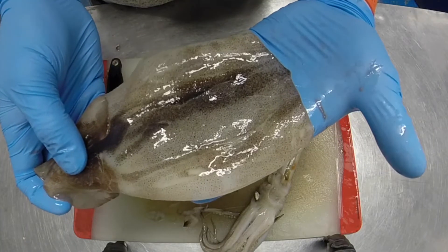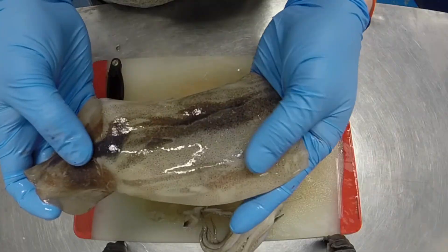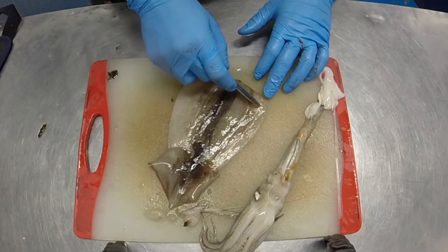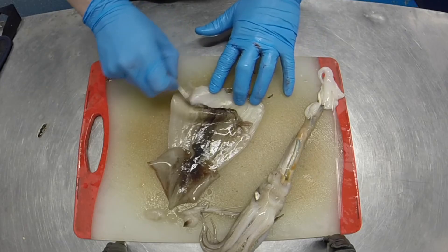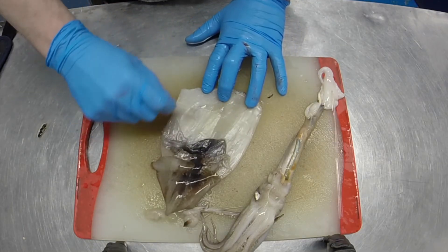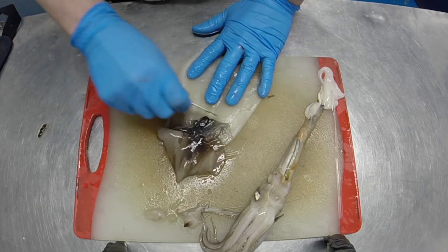The other side of the squid's mantle is the outside skin, which contains lots of what's called chromatophores. If you've ever seen displays of cuttlefish displaying to each other, you'll see they can amazingly change colour — they've got quite a range of colour-changing ability in order to communicate and ward off predators. Squid use chromatophores less so, but certainly some squid do use chromatophores in order to communicate.